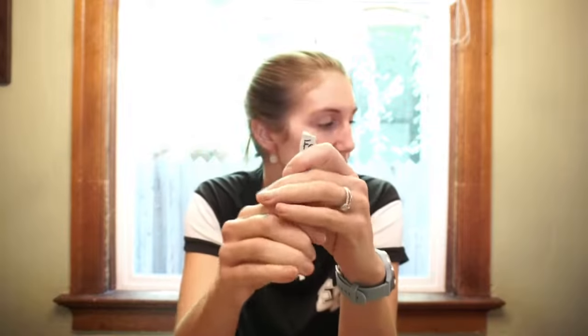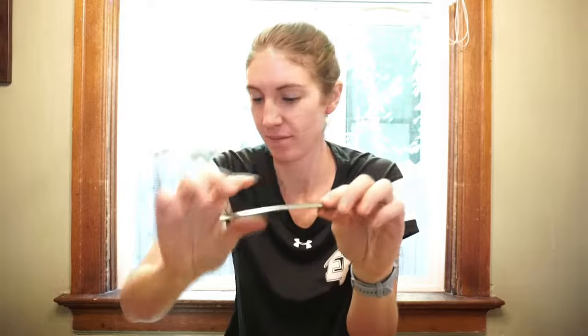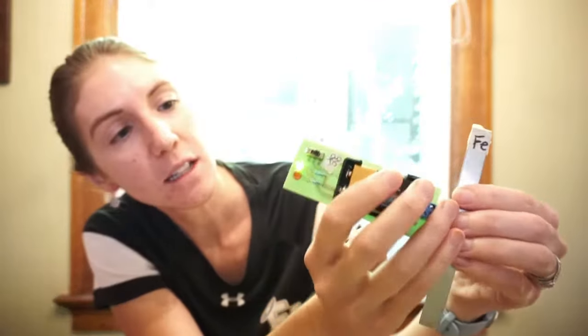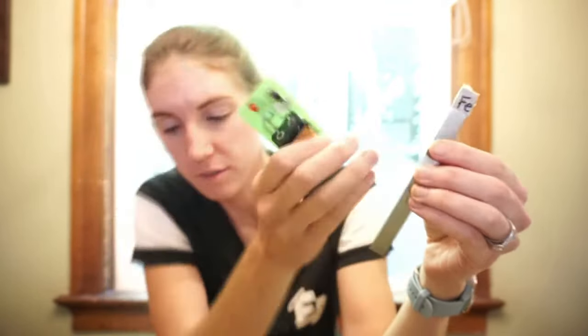Next up, we have the element Fe. That's capital F and lowercase e. So this one here, take a look. Do you think it's shiny or dull? This one's a little hard, but can we bend it? Let's see, does it conduct electricity? And last but not least, is it magnetic?